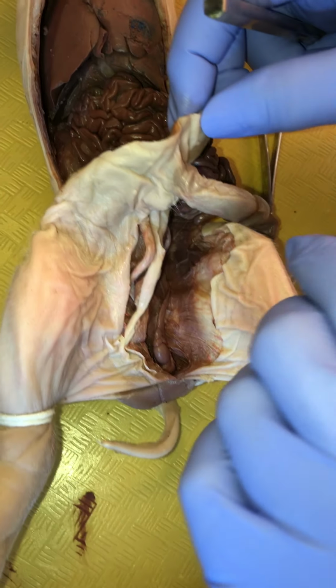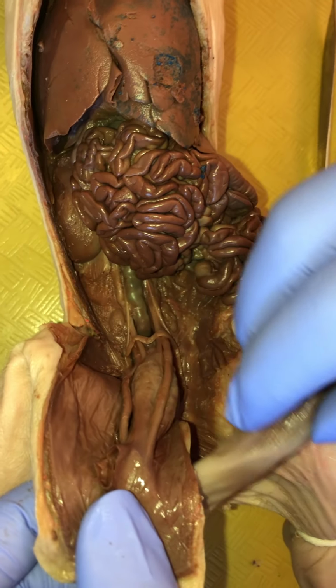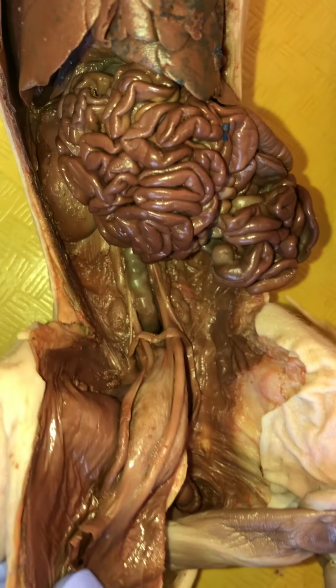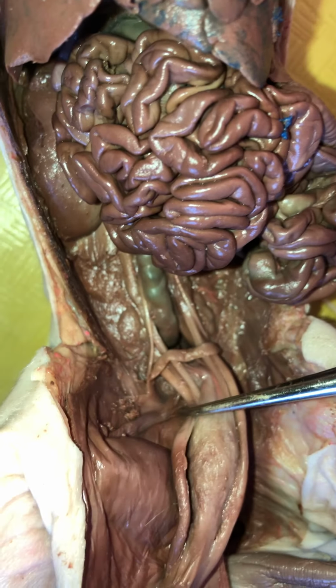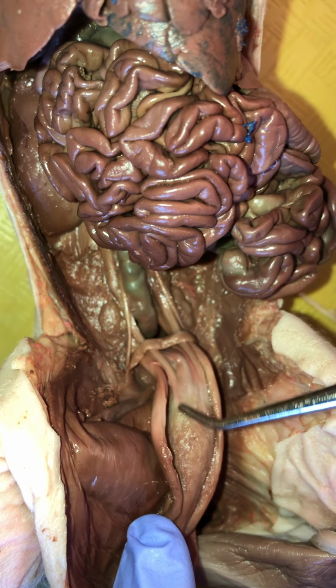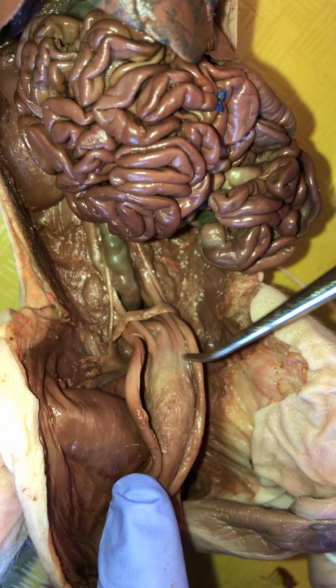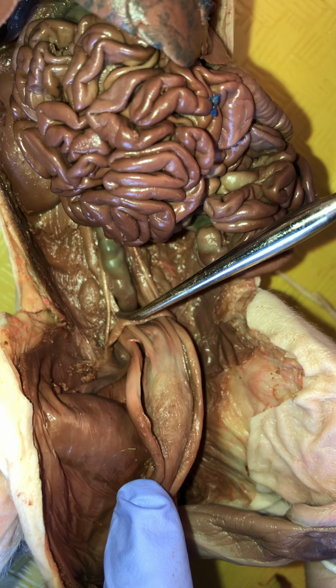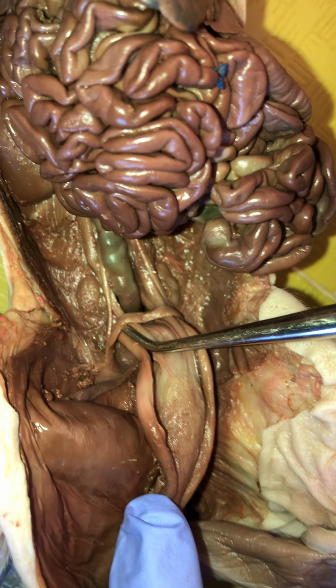All right, but speaking of the coelomic cavity, let's go back into what feels like a familiar part of the coelomic cavity. That is the base of the abdominal cavity. And look in here. And look down there. Oh, isn't that interesting? So here we are. If we get oriented, we have a urinary bladder. We have the umbilical arteries. We have the ureters. And then this kind of tape-like, really tough thing.